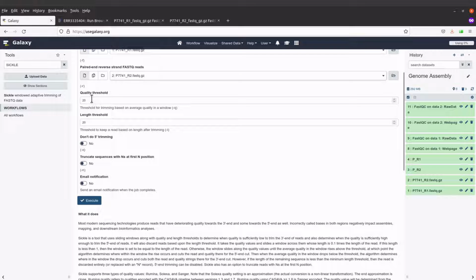I will leave everything as it is. With the quality threshold, you can increase it as well, but I will leave it. Length, you can increase, but I'll leave it with the default settings. And then I will execute this. So I'll click on execute, and then trimming will start. So let's do that.